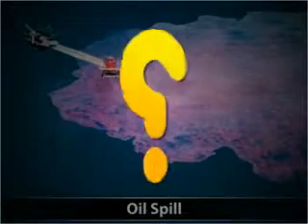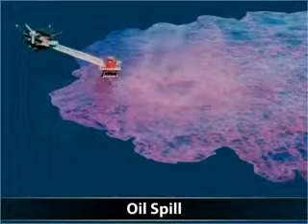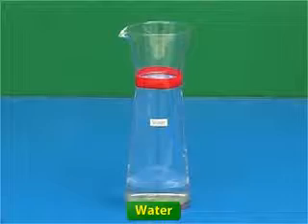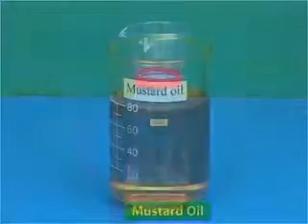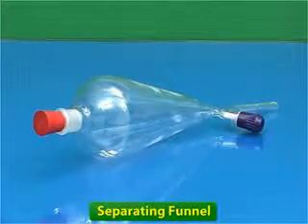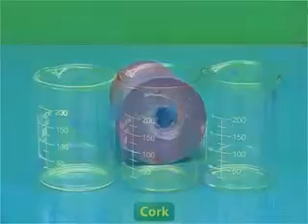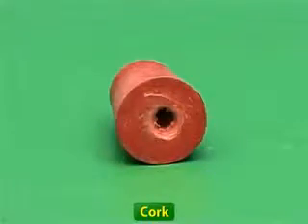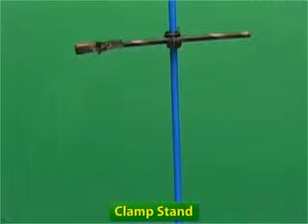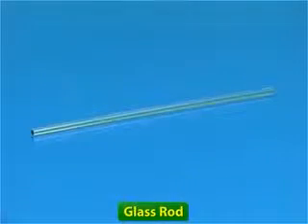But how can these two be separated? Let us find out by performing an activity. To do this activity, you will need water, mustard oil, a separating funnel, three beakers, a cork, a clamp stand, a measuring cylinder, and a glass rod.